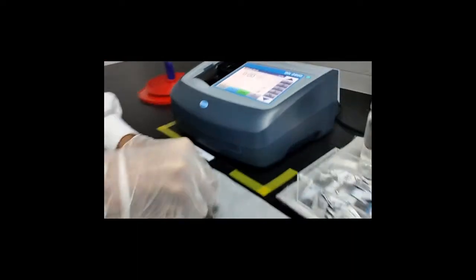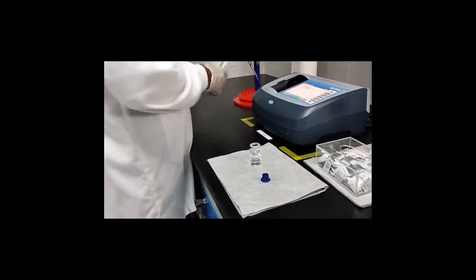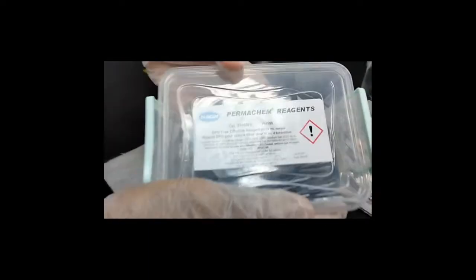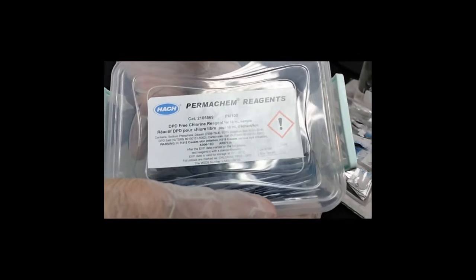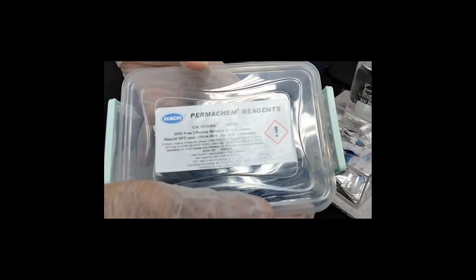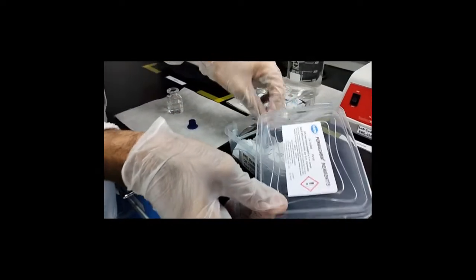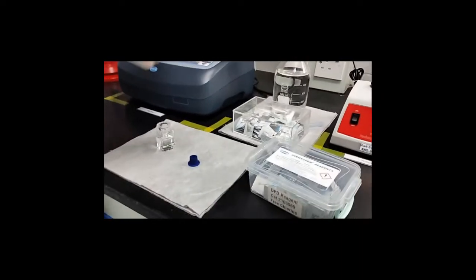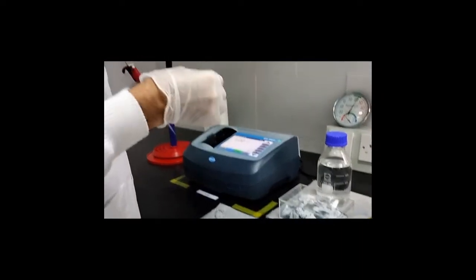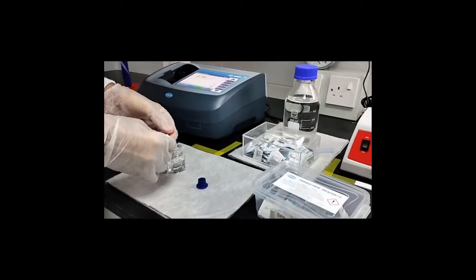Now the same cell with 10 ml of your sample, you will add now DPD free chlorine reagent. This is from HACH, and this reagent is for 10 ml of sample. So I will add one powder pillow in my cell. Make sure all the particles come down. So you will add all the amount of your reagent.